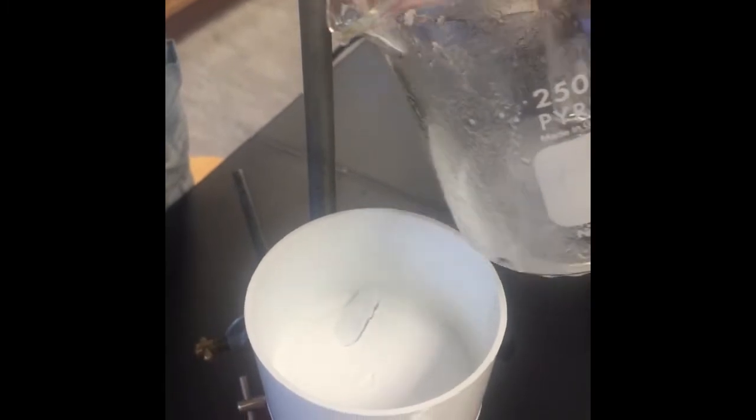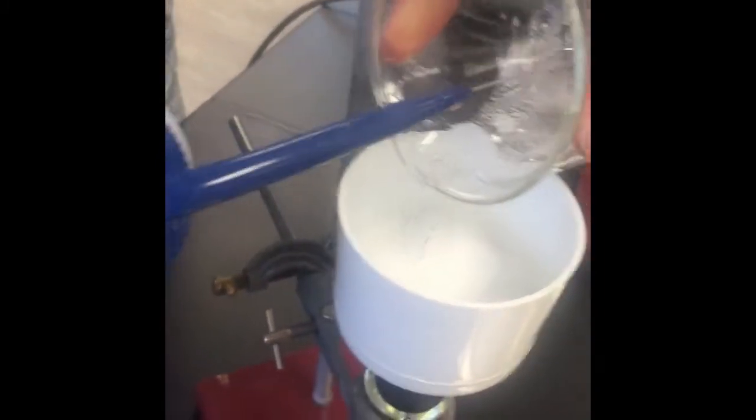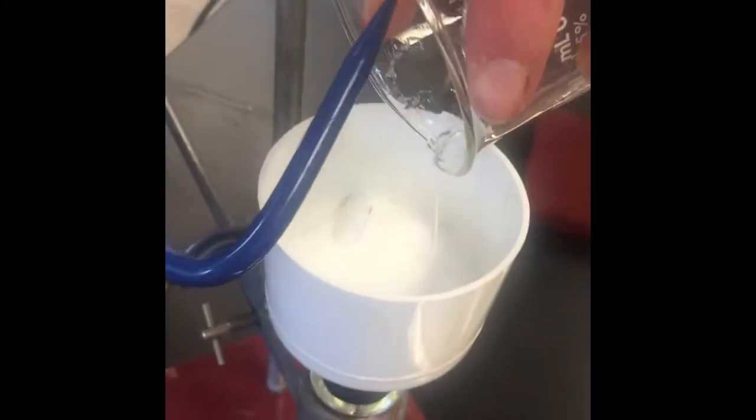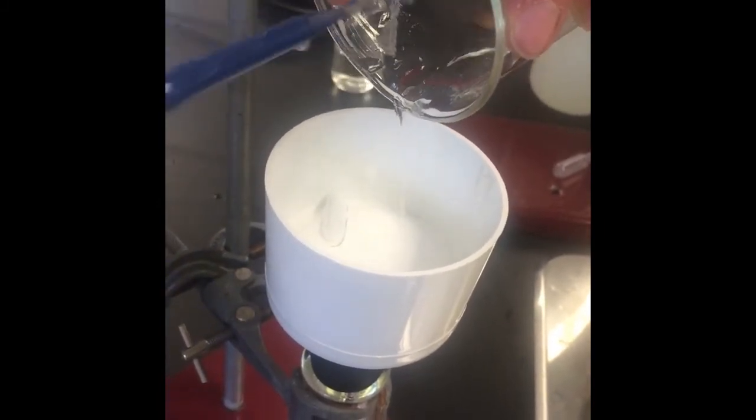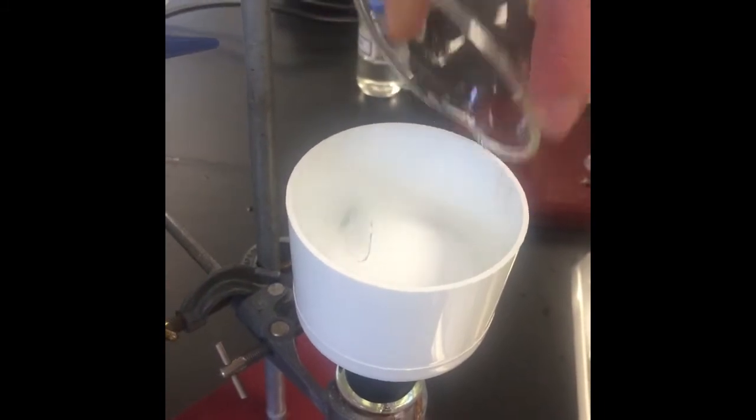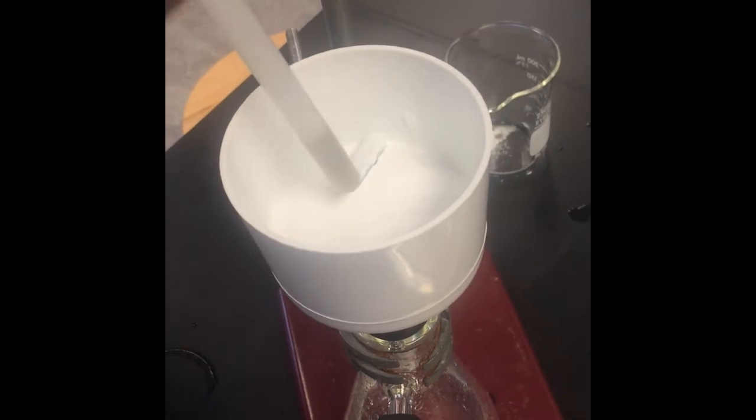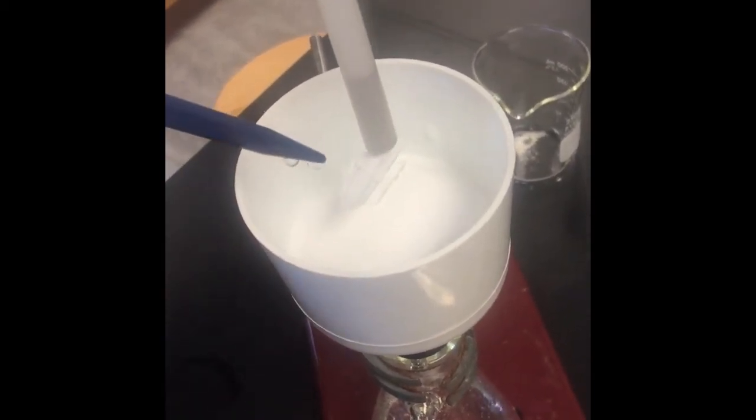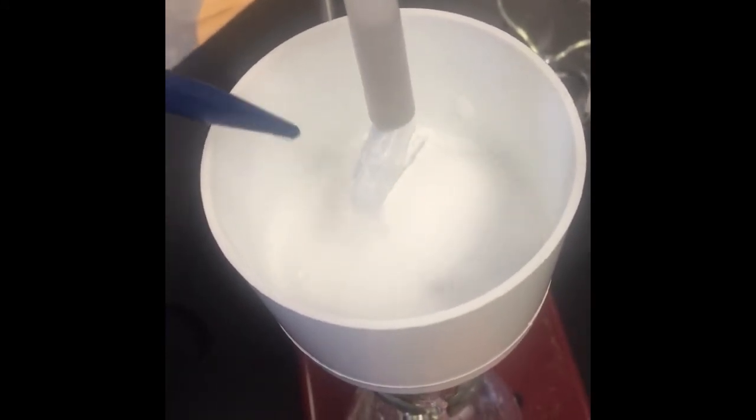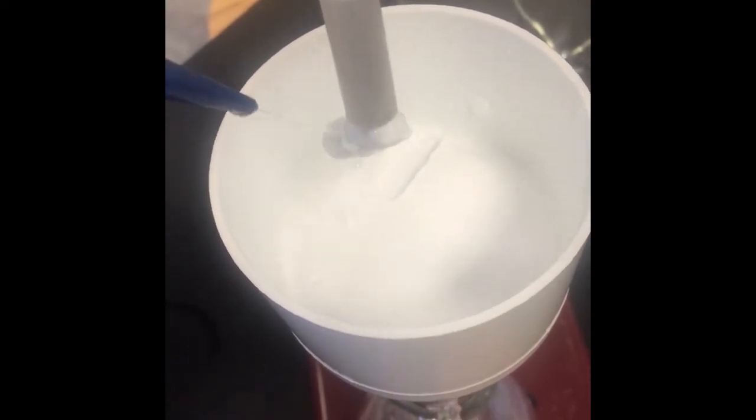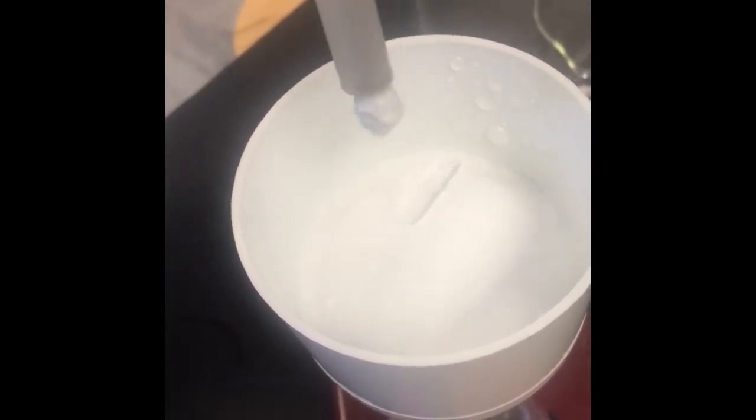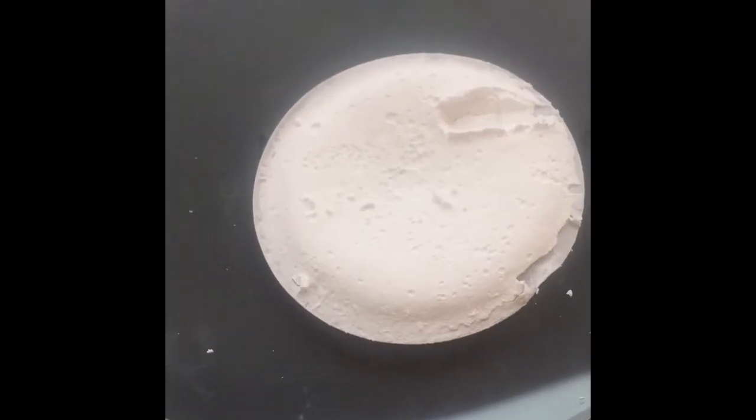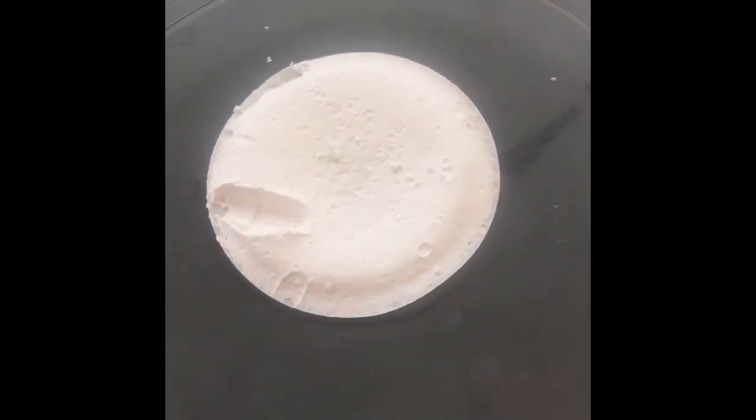And because this is not very soluble in cold water we can wash with lots of water. And here we have our nice salicylic acid, ready to be recrystallized.